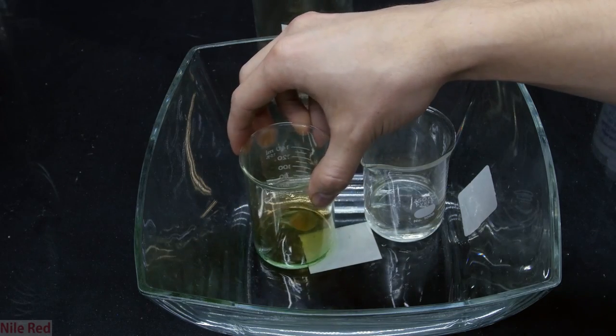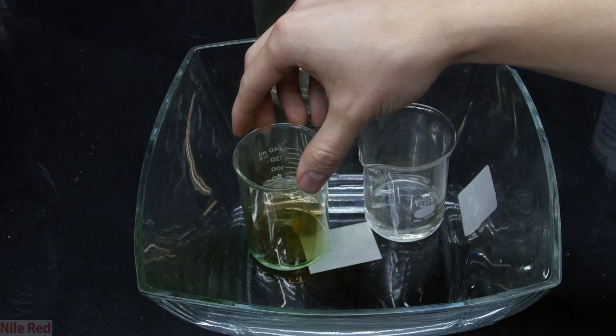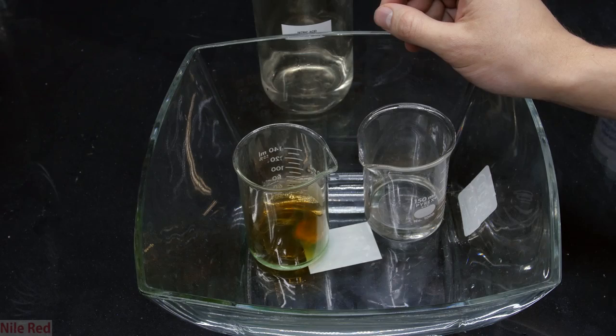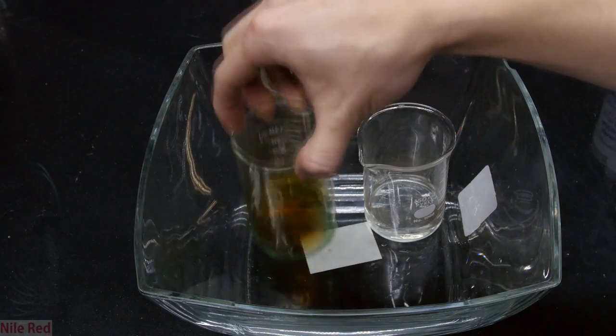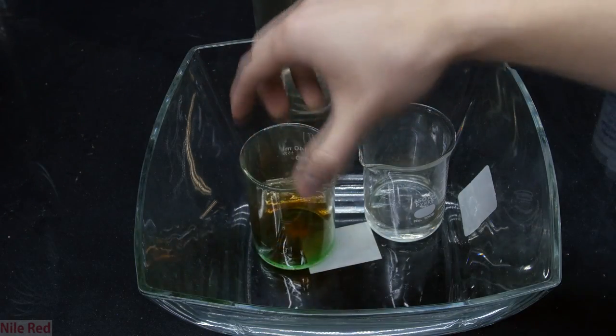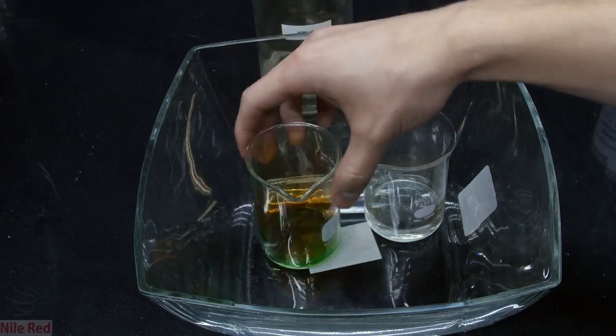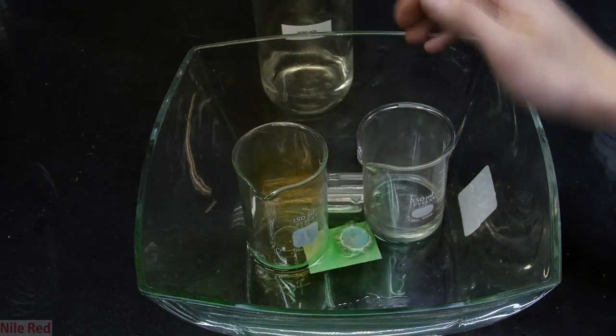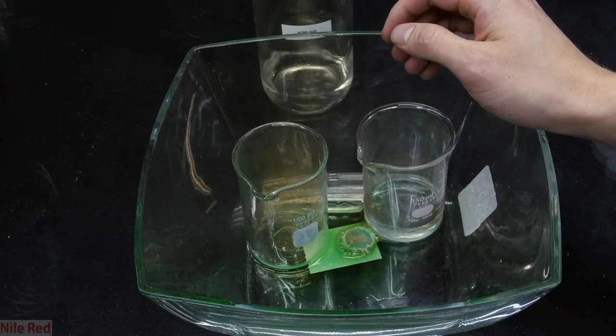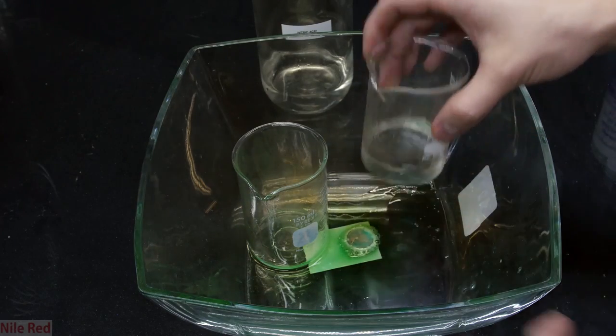For this part of the demonstration I had to wear a good respirator because nitrogen dioxide gas is actually quite toxic. My foolish mistake was pouring out the contents of the beaker and allowing the penny to continue to react while I do the demonstration. This produced a crazy amount of nitrogen dioxide gas and was really unnecessary.